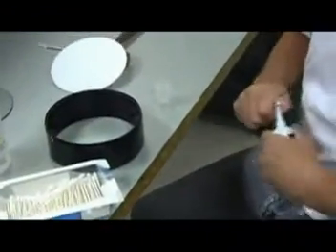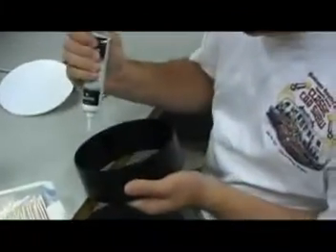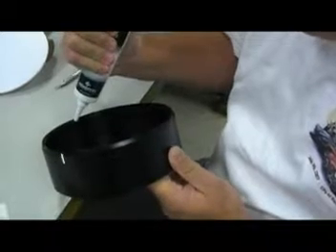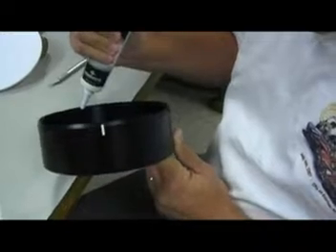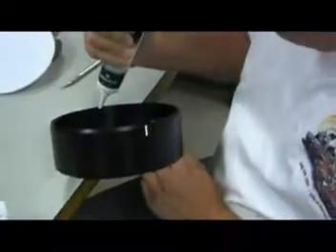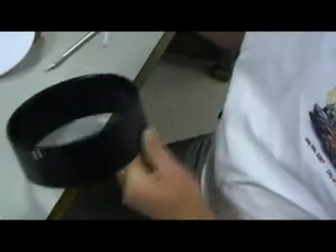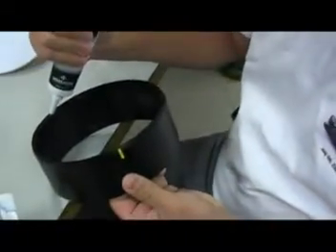We are using black silicone RTV. You can get it in these small tubes. What we're going to want to do is put a fairly thick bead in that entire groove, making sure that there are no voids or air bubbles. We've got to be careful that when we get around to where we started putting the RTV on, where the bead joins up again, we have complete coverage.